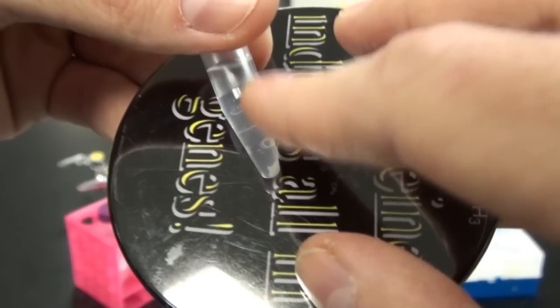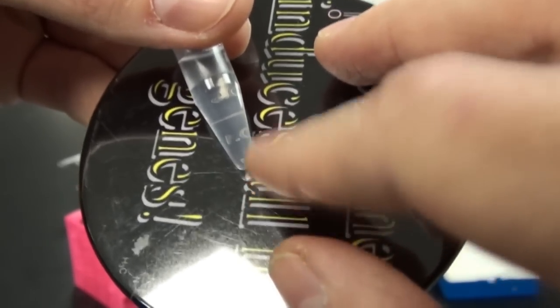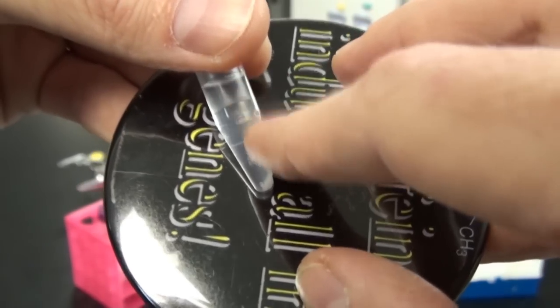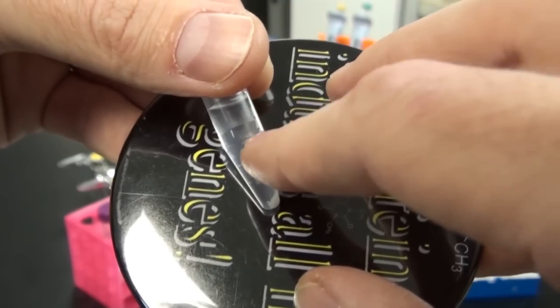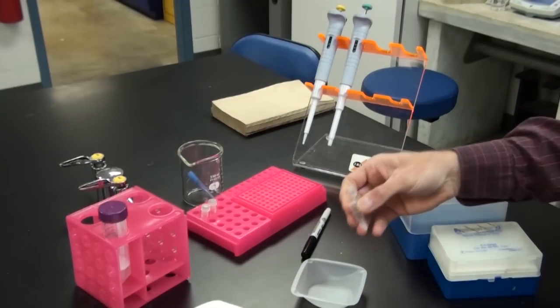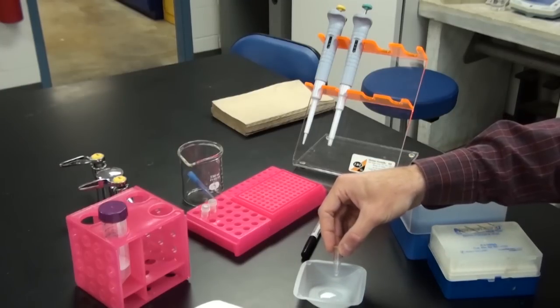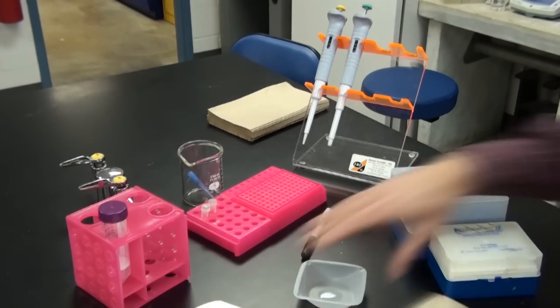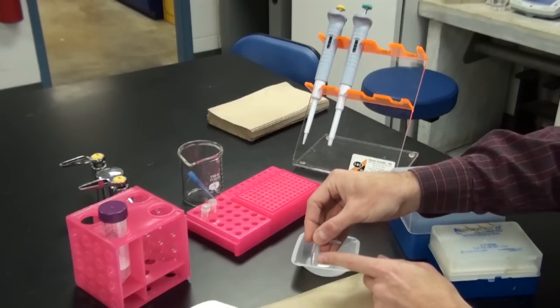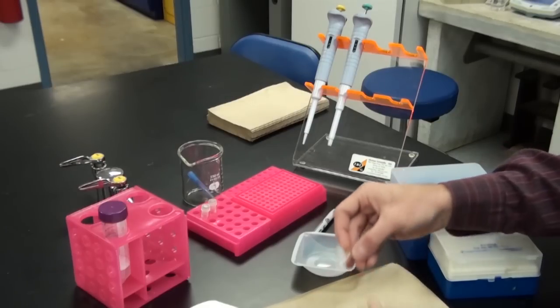Make sure you keep the pellet here. Then add more of your cell suspension and centrifuge again. The point is you need to have cells otherwise you can't have DNA. Once again, pellet is a little white thing at the bottom and then the supernatant is the liquid. What we want to do is pour this off or what we call decant. We're going to keep the cells at the bottom. I always like to just have an empty container I can do this in. This is nothing fancy. You want to just pour that liquid off, shake it a little bit. You might be left with a little bit at the bottom. That's okay. What I'll actually do, take a paper towel, tap it just to get rid of that. Be careful because sometimes that pellet can be dislodged. But it is okay to have a little bit of liquid.